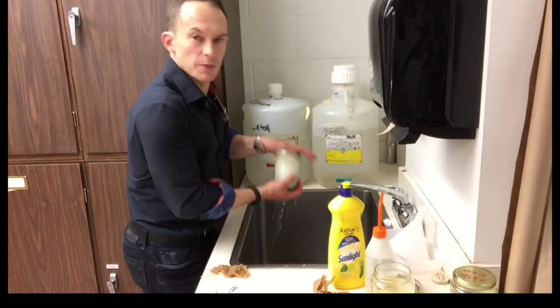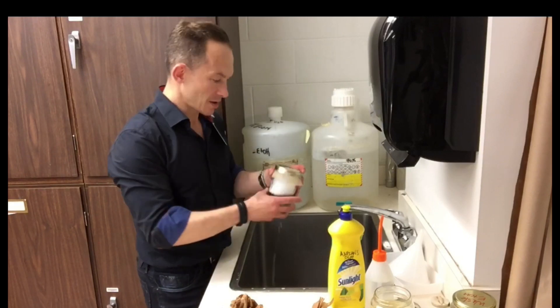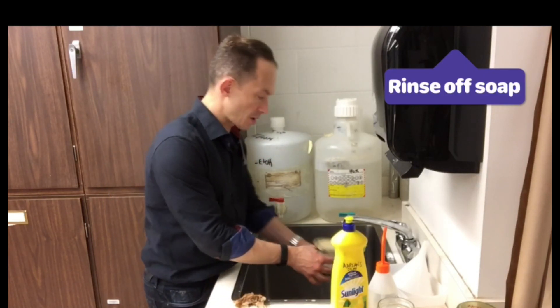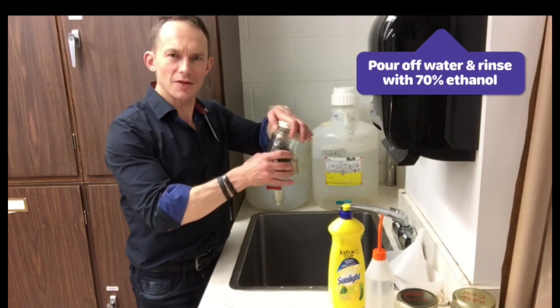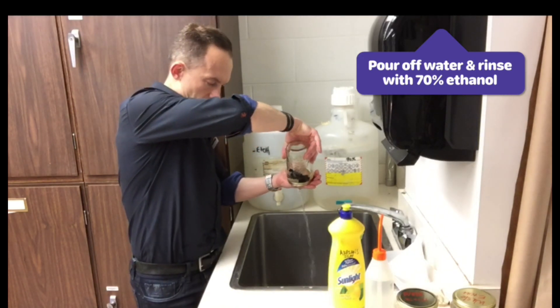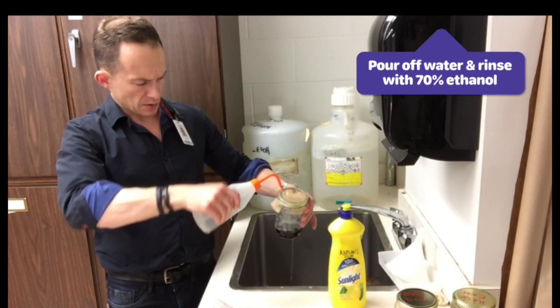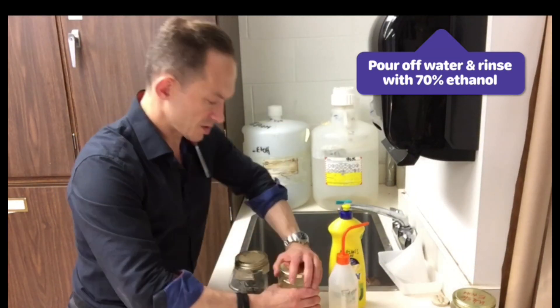You want to wash for about a minute with slightly warm water. Next you want to rinse out all the soapy water. I think they've been washed pretty well. Basically, I just put it under lukewarm water and rinse, running out the soap. I'm pretty confident I've got all the soap out. I'm just going to drain out the last of the water, and then give it a light wash with 70% alcohol — one last little swill — and pour this into the waste ethanol jar.